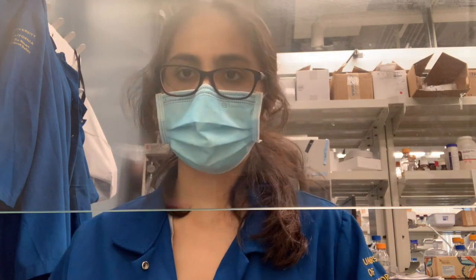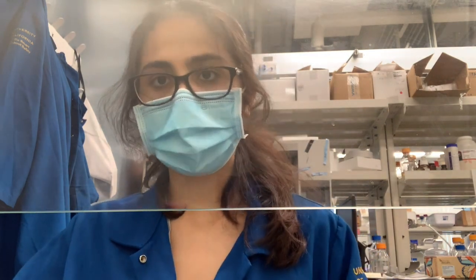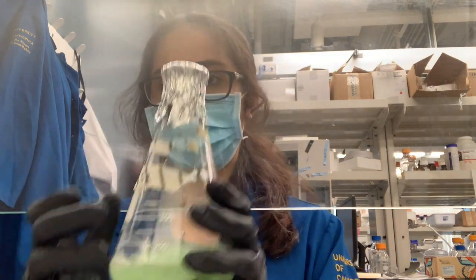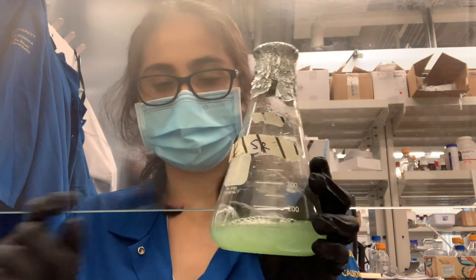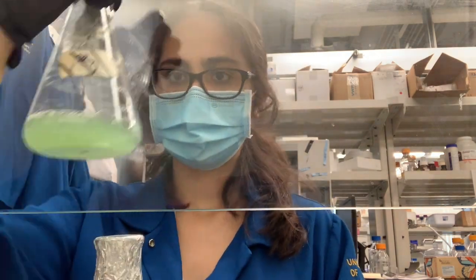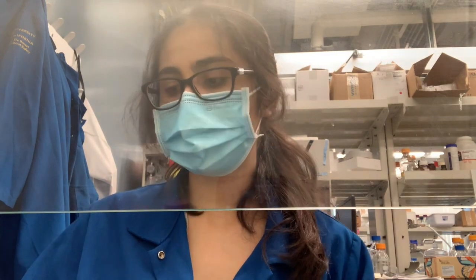Hello, I hope you're having a good day. I'm doing a voiceover because the audio is really bad. I start out with all of my cultures that have been inoculated for 18 hours, and I number each of them 1, 2, 3, and they're all biological triplicates.